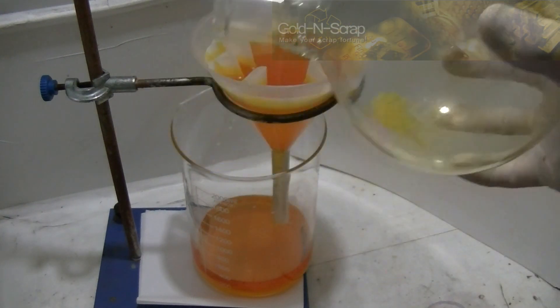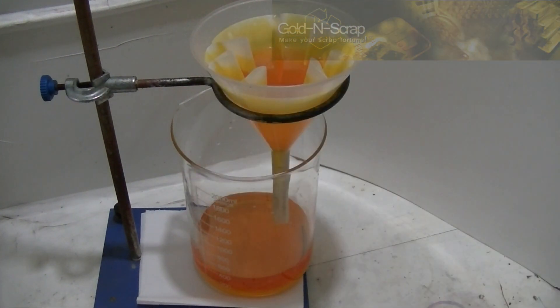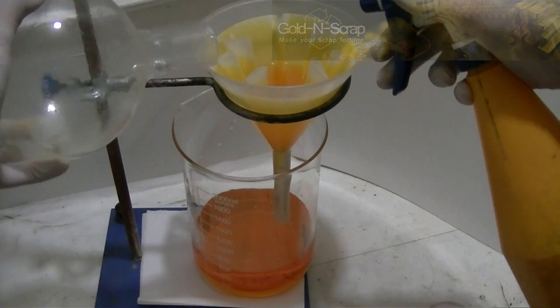Here, in the flask, you can see the remaining junk. I will just wash it several times with water and pour it down the filter. The bulk of the solids are left in the flask.